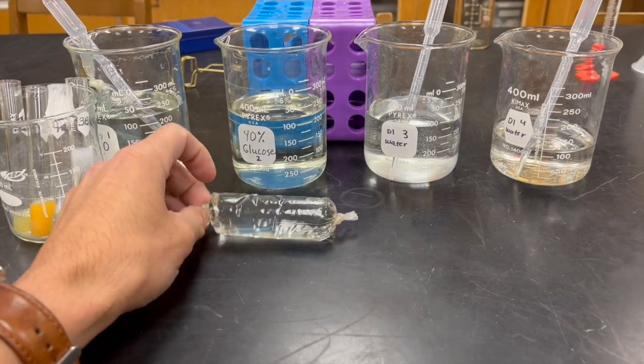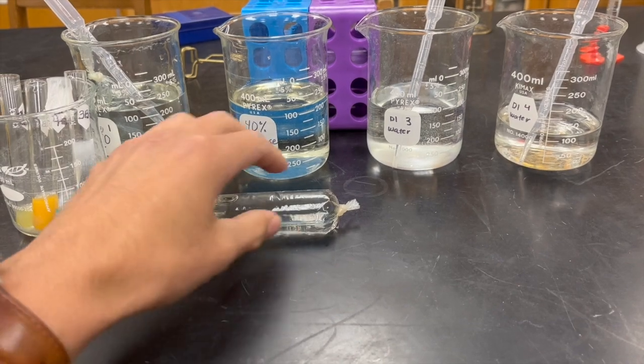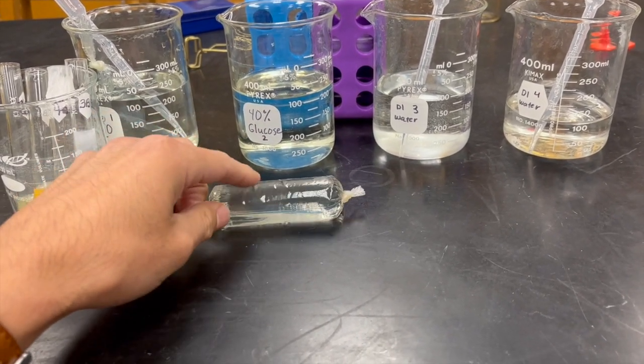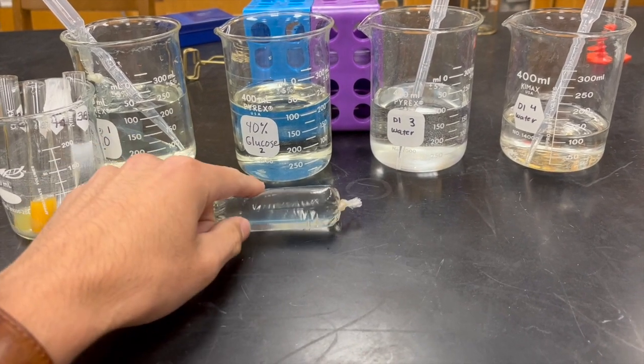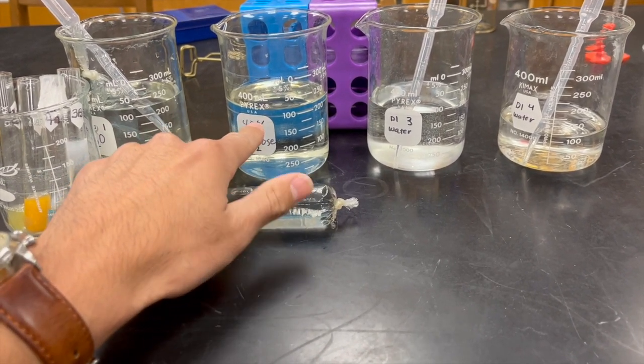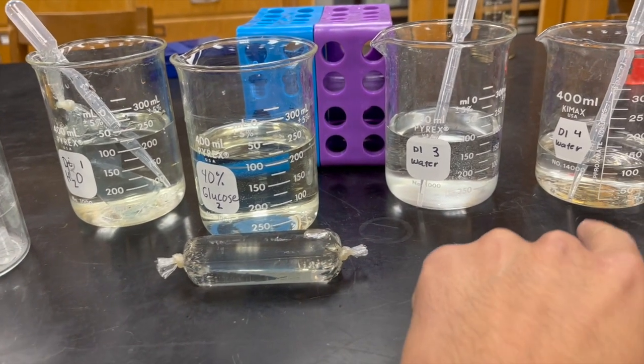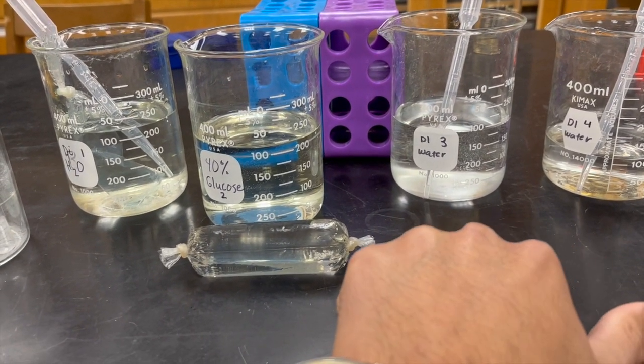The 40% glucose bag, we can reuse this throughout the week because there's not going to be a change in the weight before and after. The other three for one, three, and four, those bags have to be prepped for each lab.